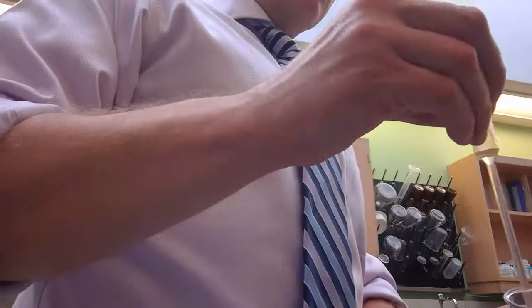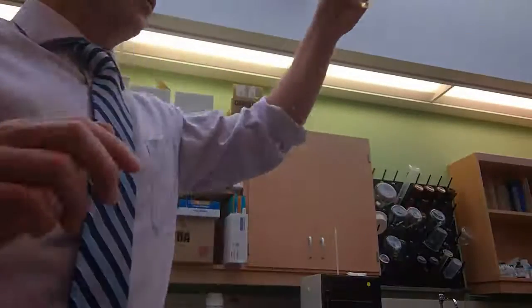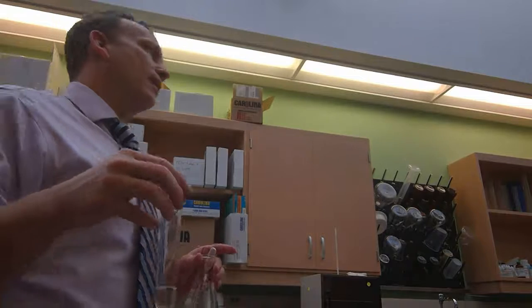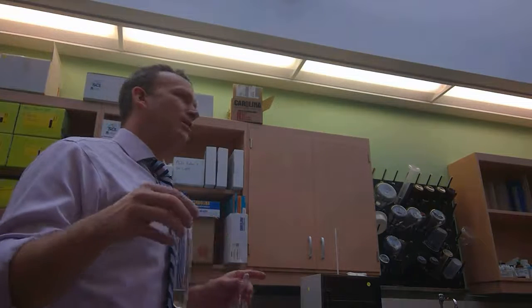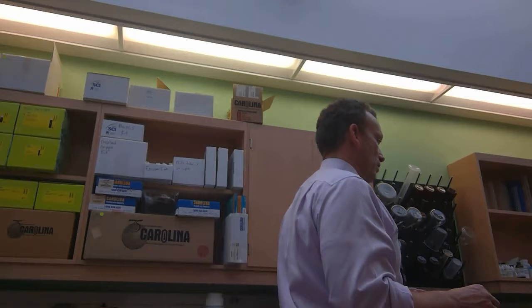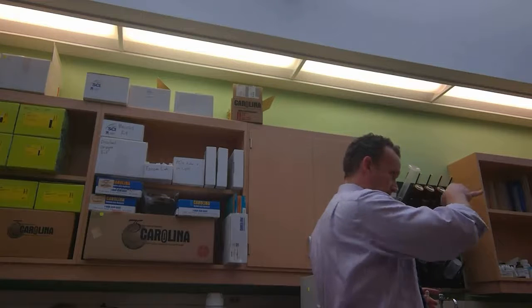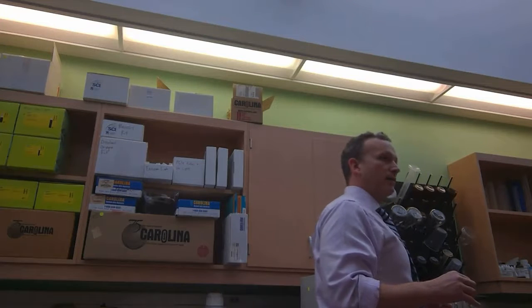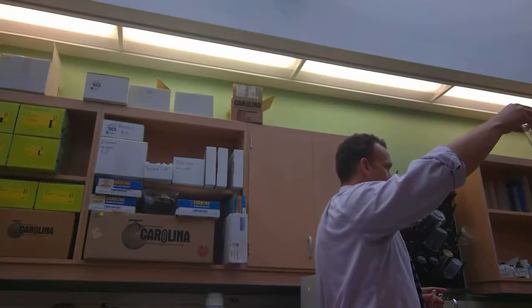You're predicting no color change, and in fact, I've added 3 milliliters in here, and it's still yellow, right? Iodine is initially yellow. Our sample still remains yellow as we add iodine to it. So that's a negative result for iodine and glucose, which we predicted, right? We expected that because glucose is what type of sugar? It's a monosaccharide, right? So that's predictable.